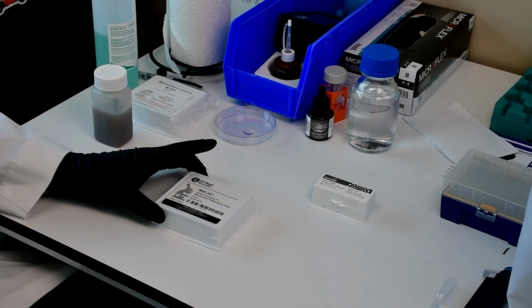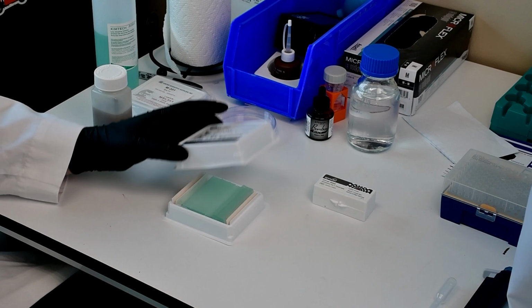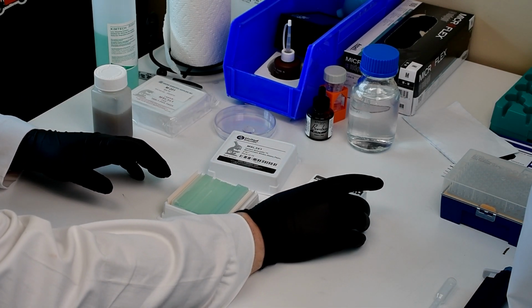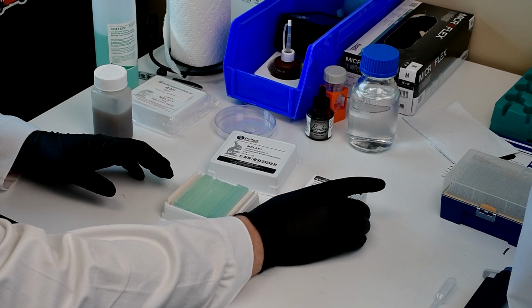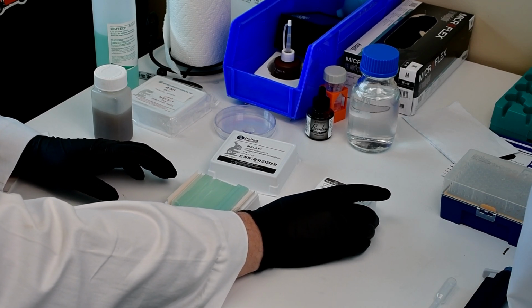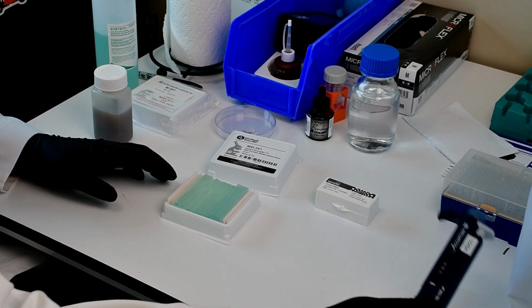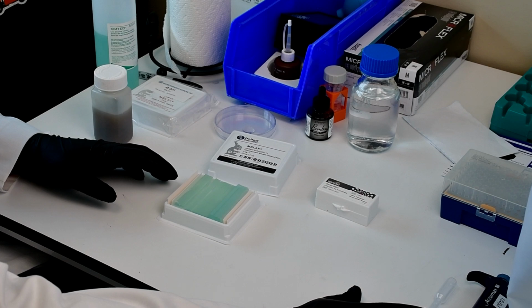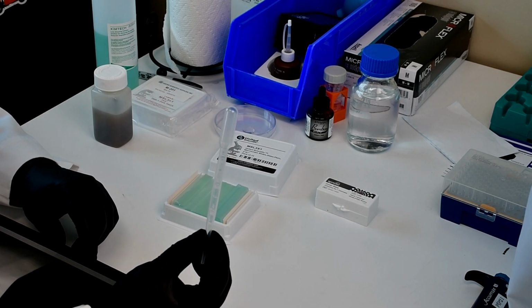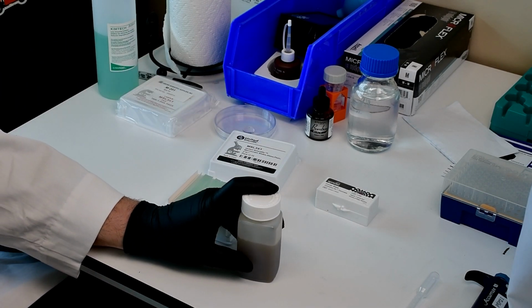You're going to need your microscope slides. These are standard glass plain microscope slides. They're going to come in a package like this. You'll need cover slips. These are also glass, just standard cover slips for a microscope slide. Now at Aquafix, we use a micropipetter, 10 to 100 microliters. This isn't something that you need to use, and today I'll show you how to prep using just a standard transfer pipette. I have my mixed liquor sample here.